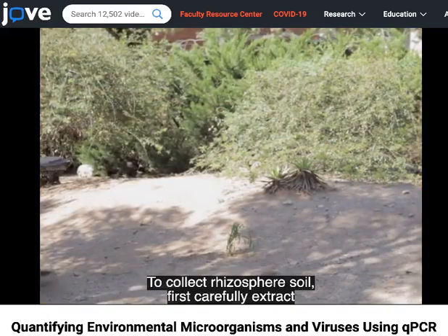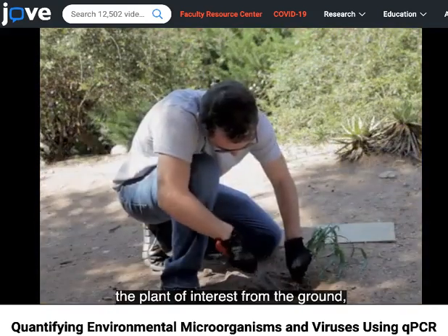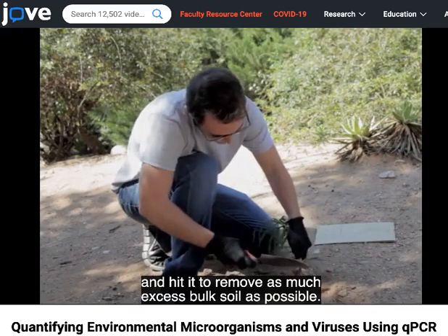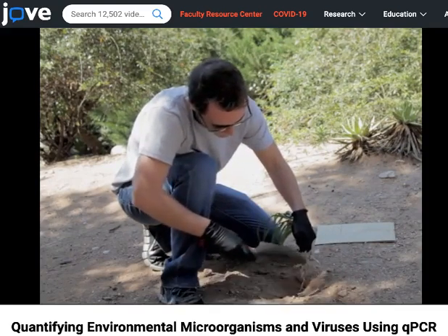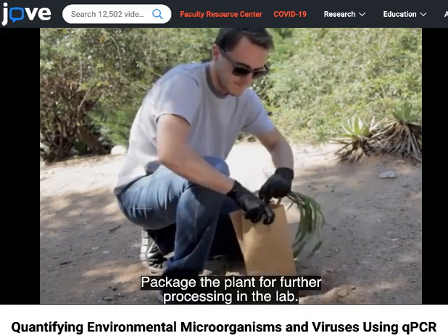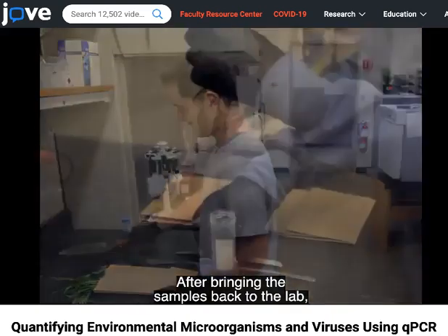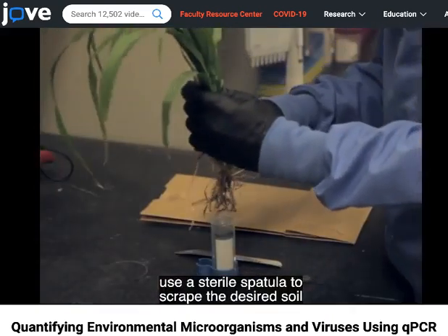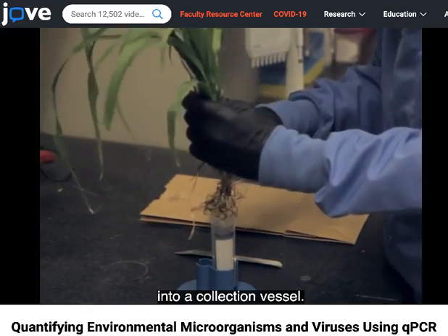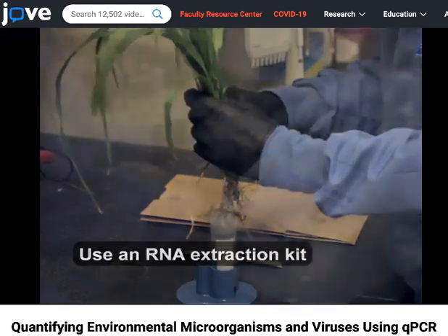To collect rhizosphere soil, first carefully extract the plant of interest from the ground, and hit it to remove as much excess bulk soil as possible. Package the plant for further processing in the lab. After bringing the samples back to the lab, use a sterile spatula to scrape the desired soil into a collection vessel. Then collect the virus from the soil and extract the RNA.